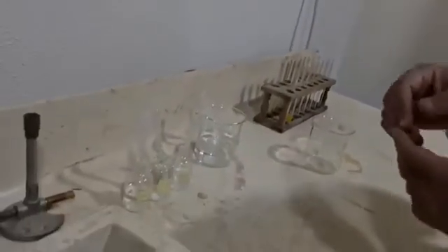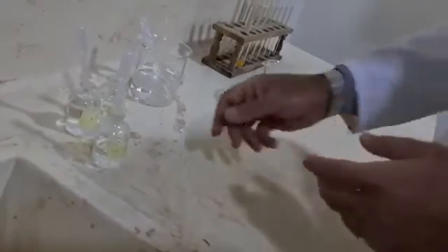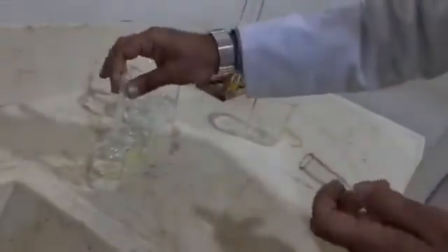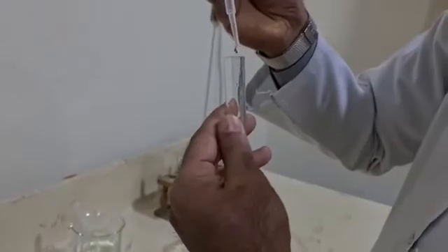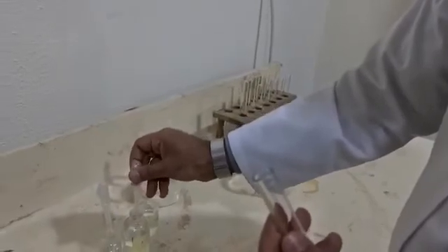Calcium ions can be identified by the reaction of calcium containing solution like calcium nitrate and ammonium oxalate in an alkaline medium to form calcium oxalate, which is a white precipitate. In a clean dry test tube, we have to take 10 drops of calcium nitrate and 4 drops from the ammonia to obtain an alkaline medium.